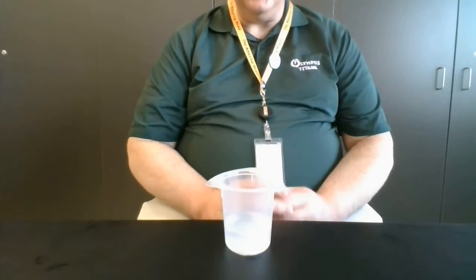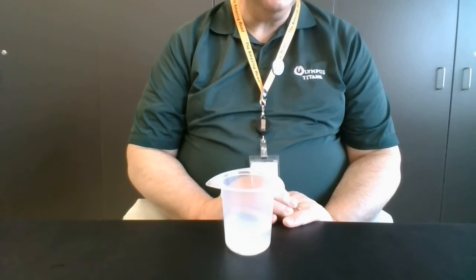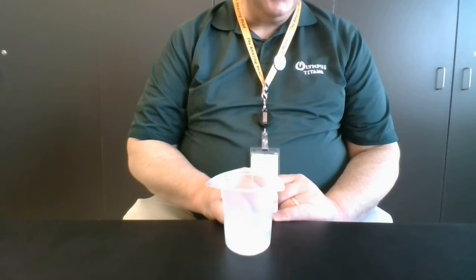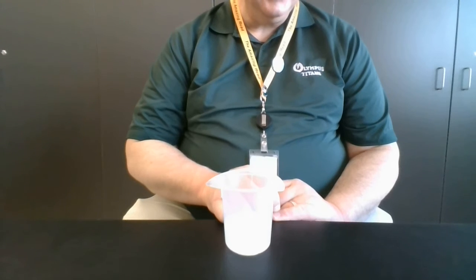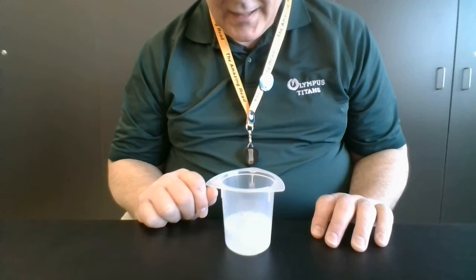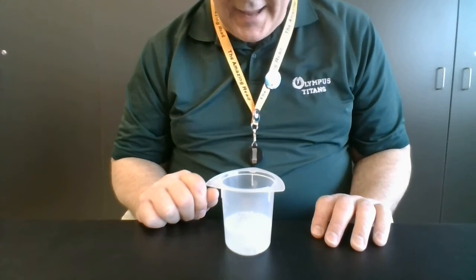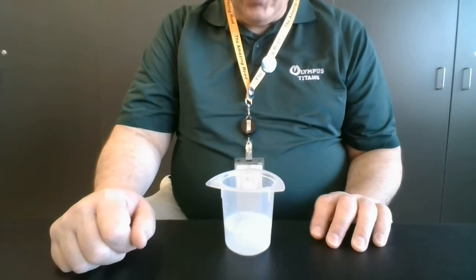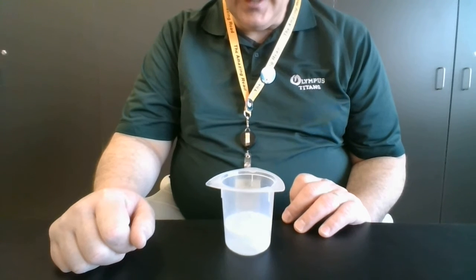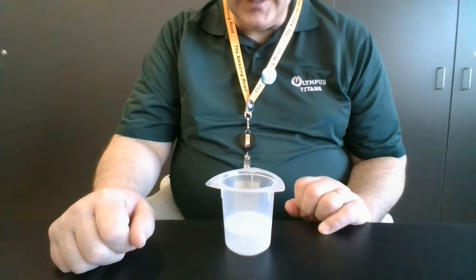At this point, all we can do is watch it bubble. It's really not all that exciting, but there it is. So going along, I can still see the tablet is mostly intact down there. Pointing out here that we make sure we use an intact tablet every time. That way we know that we have similar conditions in every case.